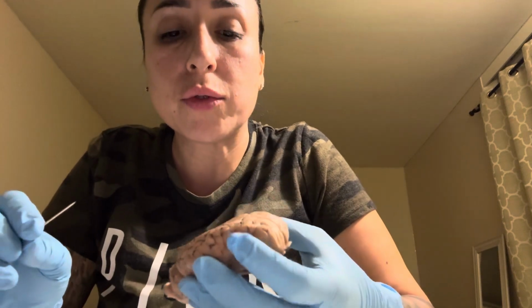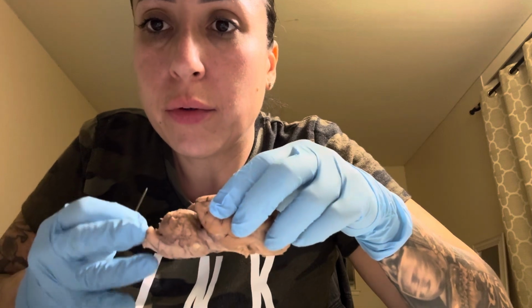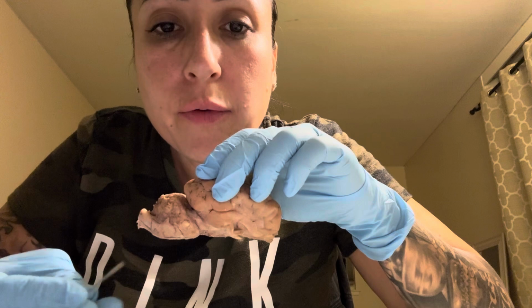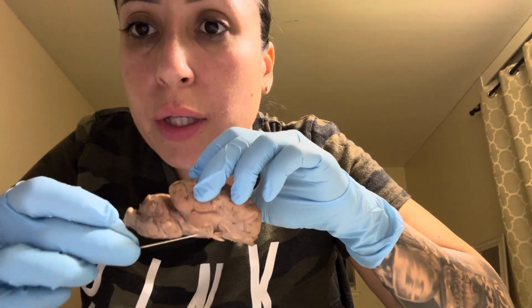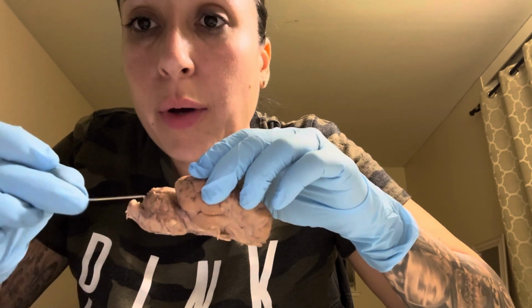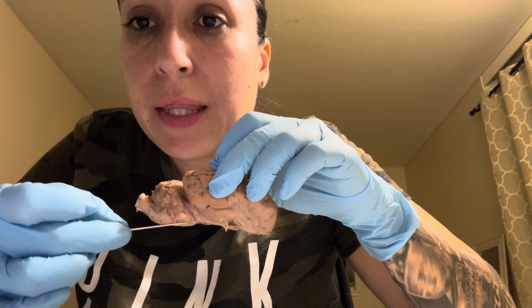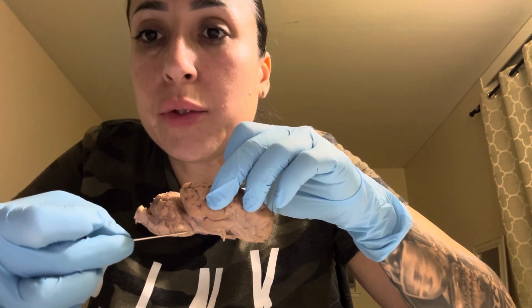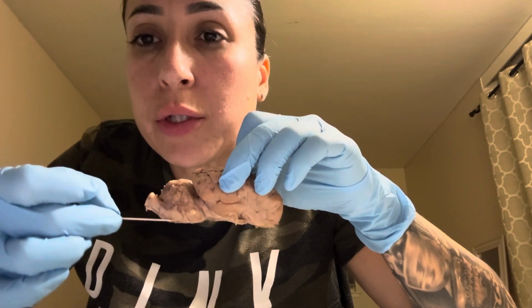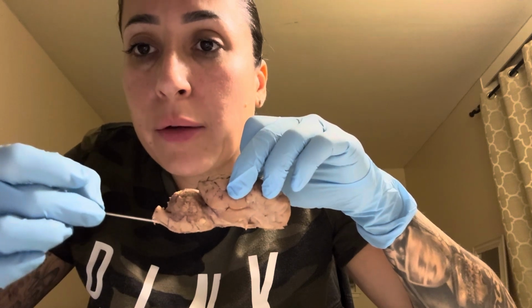And then we're going to go to the lateral view. So in the lateral view, it's all dry now. In the lateral view, I have to start by showing you the temporal lobe, which is where our sounds are processed. And then the pons is this right here, which links the brain to the spinal cord. And then we have the medulla oblongata, which controls some processes like the blood pressure. And then we have the spinal cord right here.